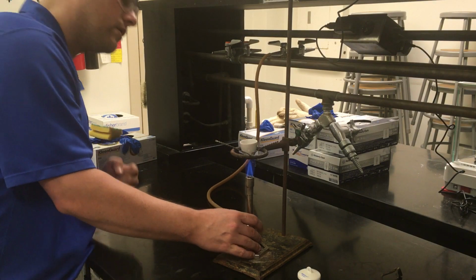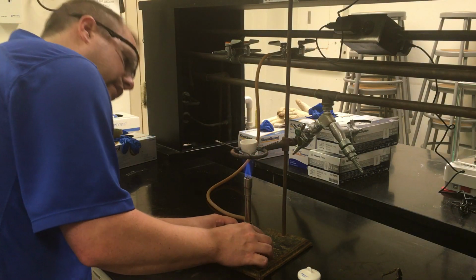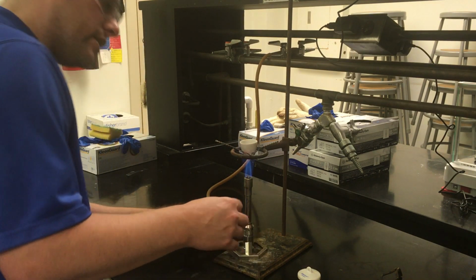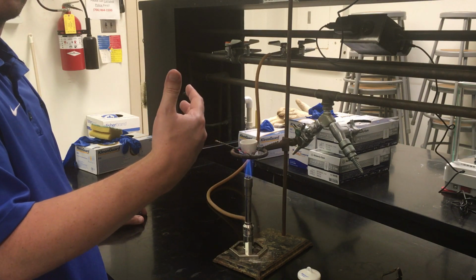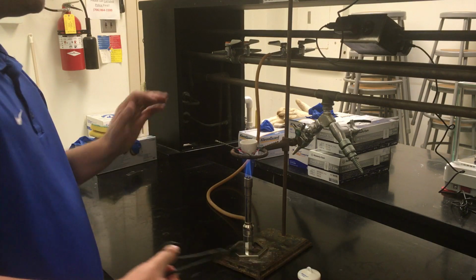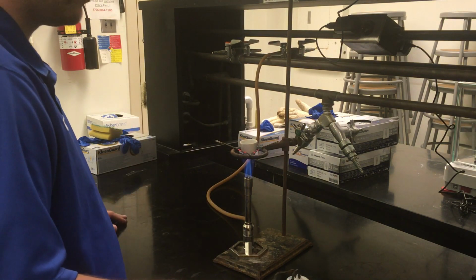Once you've done that a little bit, you can go ahead and set your flame underneath, and you can either adjust the height of your ring stand, or adjust the height of the flame to match where your crucible is. Either way, what you want is the tip of that blue flame to be more or less touching the very bottom of the crucible. After a little bit, you should see the bottom of your crucible start to glow red. Now, when you set this up, before you put the Bunsen burner on here, make sure you have your lid properly on your crucible.